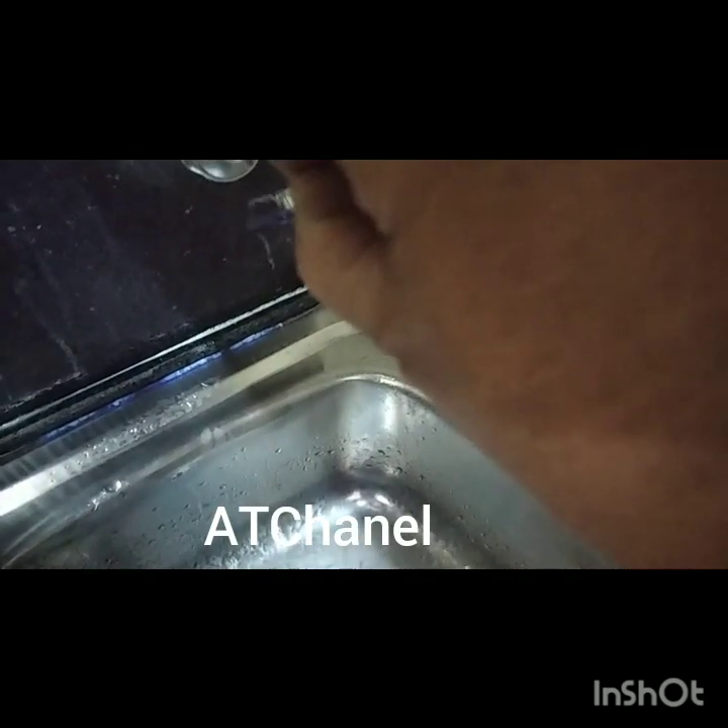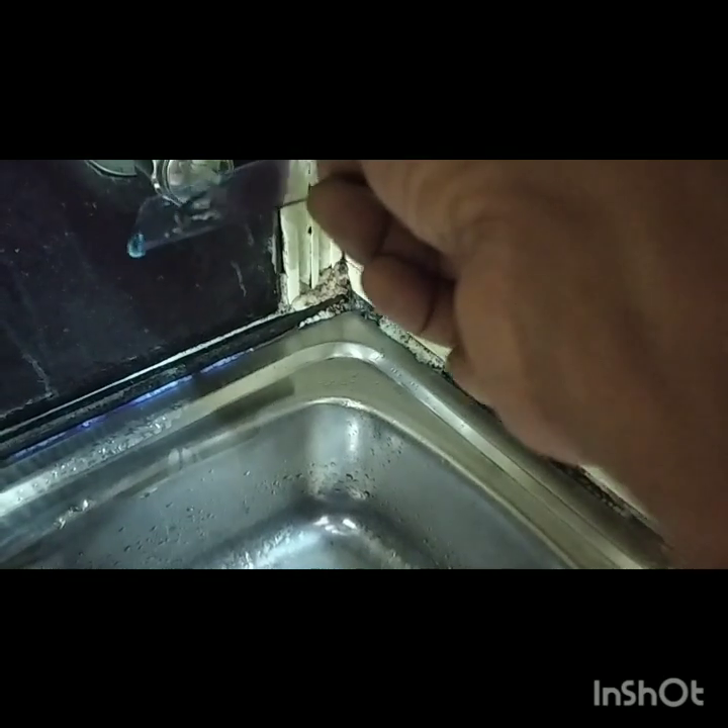This is an explanation for the MLTA students only. For senior technicians, try with the slides and check microscopically under oil immersion.